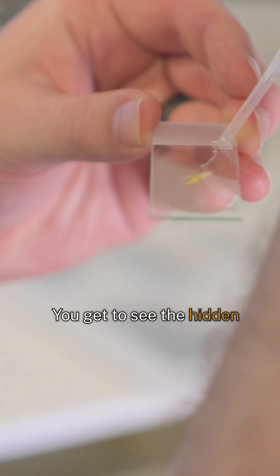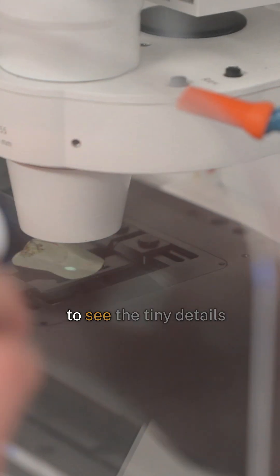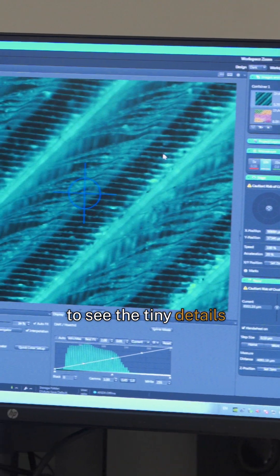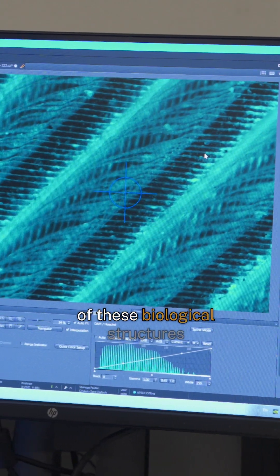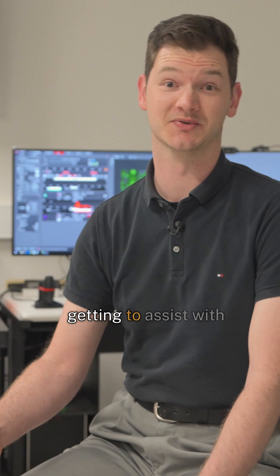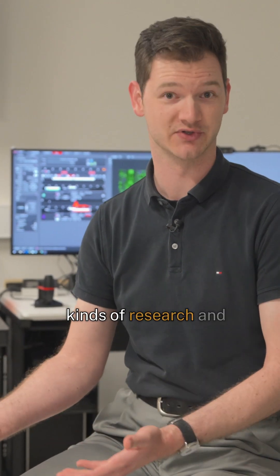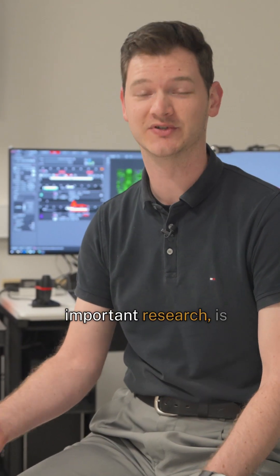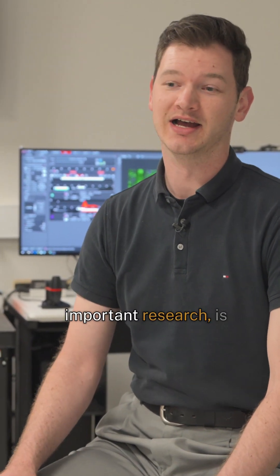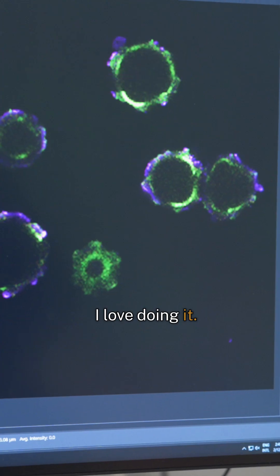You get to see the hidden detail in stuff from everyday life. Getting to see the tiny details of these biological structures down the microscope, and getting to assist with all sorts of different kinds of important research, is really exciting. I love doing it.